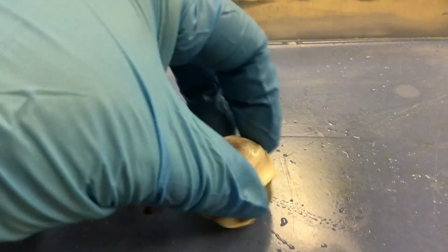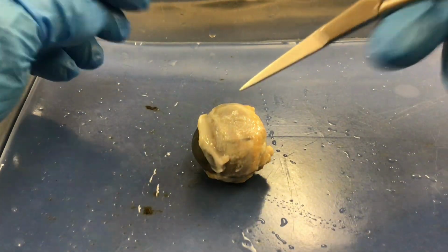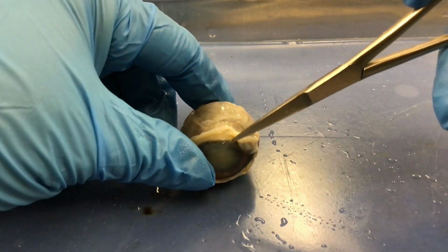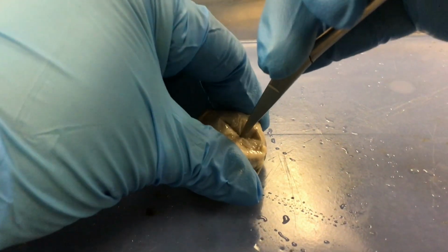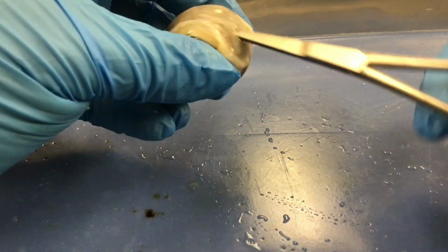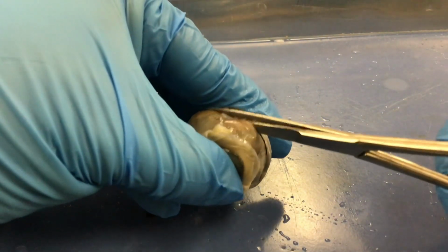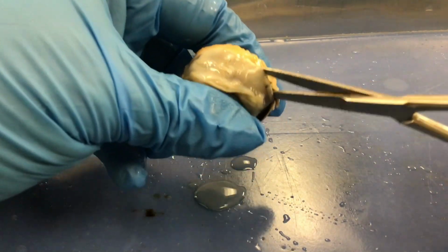Okay, now when you cut, what I tell my students to do, I don't even give them a scalpel, I give them scissors. What I tell students is that you're going to want to puncture. So you come down a little bit, offset from where the cornea is, and you're going to puncture this sclera. Now it's pretty tough. The sclera is the fibrous tunic. It helps protect the eye, so it takes a little bit of pressure to get through there. Then you're going to take the scissors and just cut around, just like this. And then you will have an anterior portion and a posterior portion of the eye.